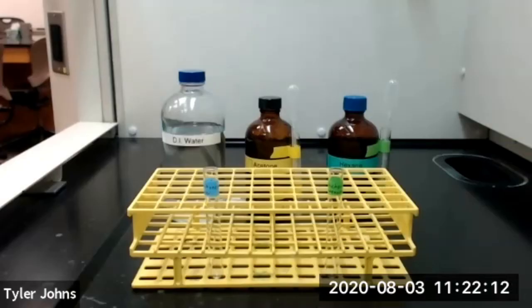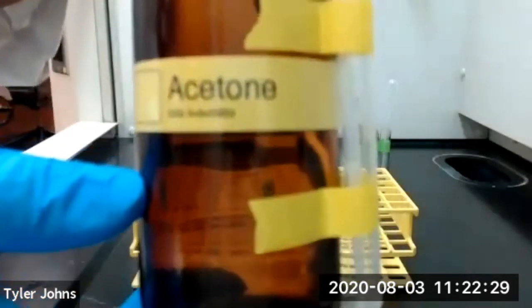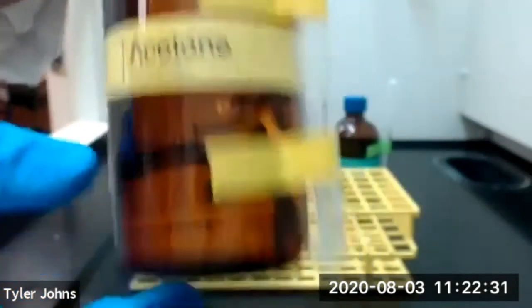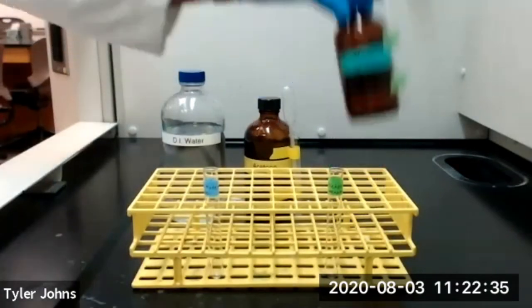Part E of this experiment is divided into 3 sections, and for section 1, we're going to determine whether 2 liquids are miscible or immiscible, and you'll need to explain the results. So the liquids that we're going to be looking at are deionized water and acetone. That's our first pair of liquids. And our second pair of liquids is acetone and hexane.